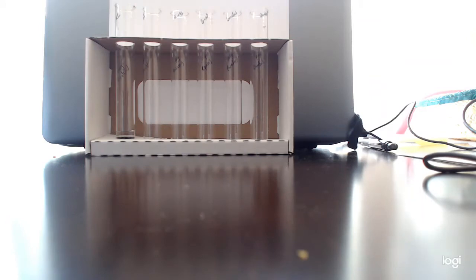So I'm going to put 5 milliliters of water in each of these tubes. So hang on, I'm going to fill these up as fast as I can. Thanks for your patience. And you'll notice I'm trying to use good lab safety protocol by using gloves, although I am dripping water everywhere, so sorry about that.